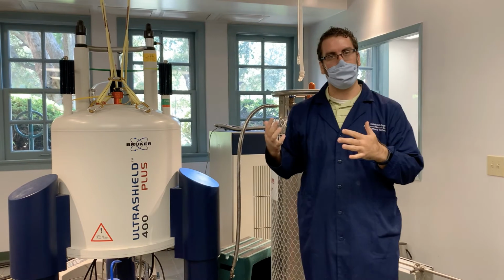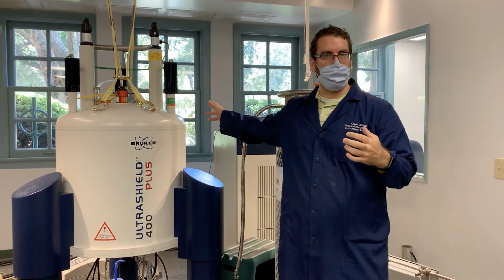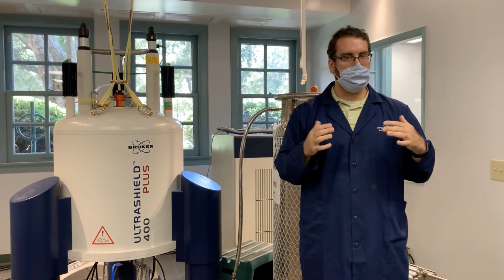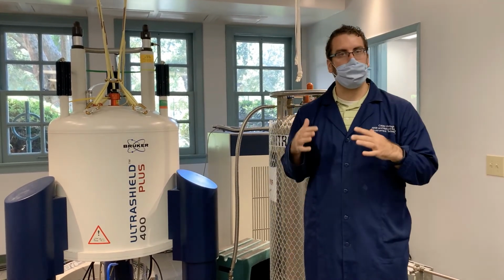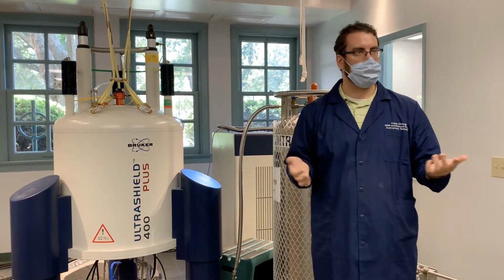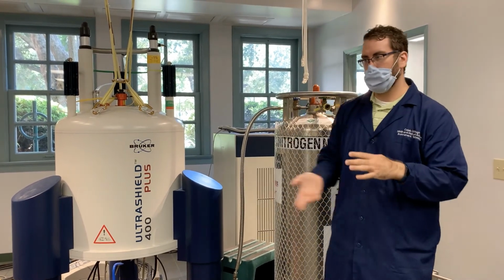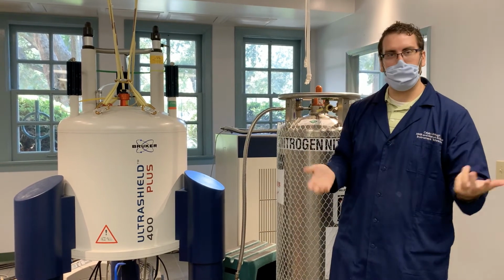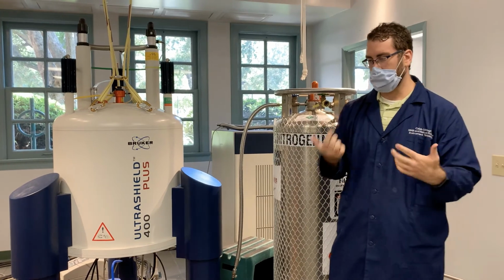As I said, we have to refill it fairly regularly, and the fact that we have the liquid nitrogen layer means the helium, which costs thousands of dollars per fill, we only have to do every 4 to 6 months, whereas the liquid nitrogen, which costs tens to hundreds of dollars per fill, we do every few weeks. So having the extra layer of liquid nitrogen means that we don't have to spend quite as much money refilling with helium.